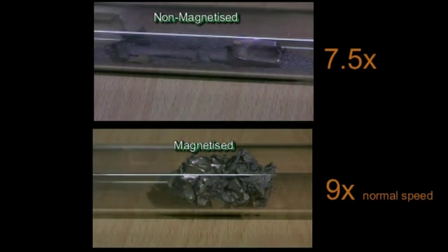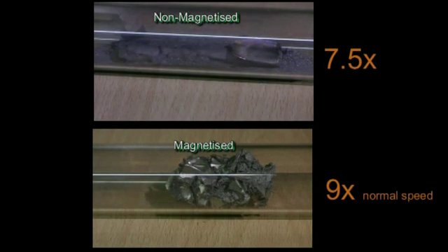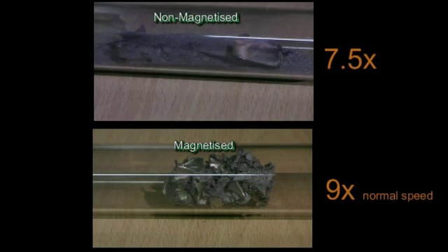One of the interesting things about this material is that when it is magnetised, as the bottom sample is, on formation of a metal hydride, the material loses its permanent magnetism.